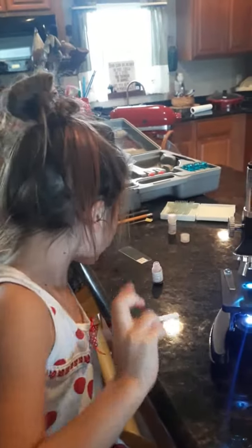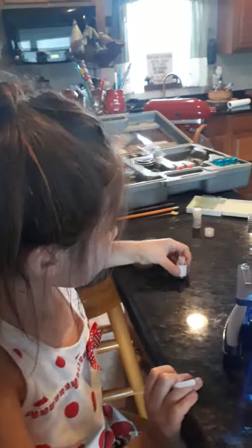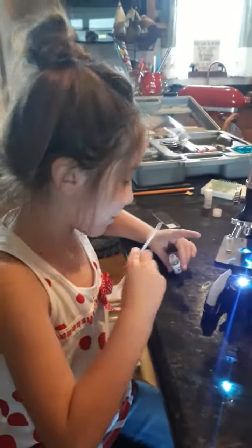We're going to put some dye on it because sometimes things you can't see without coloring, so let's put some dye on it.